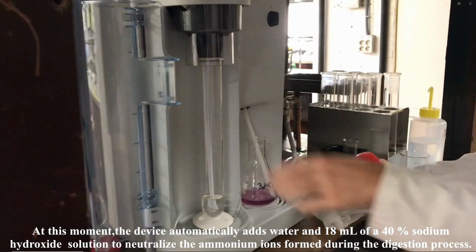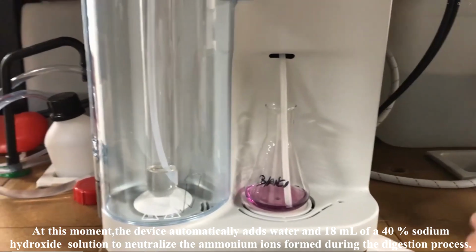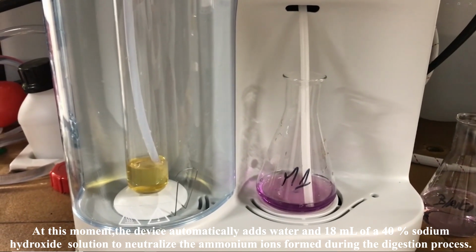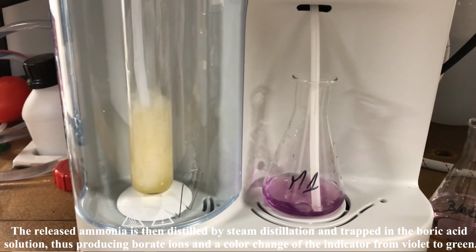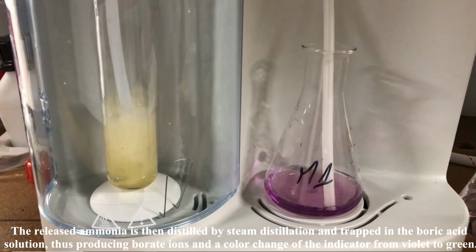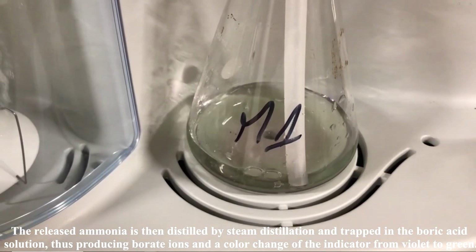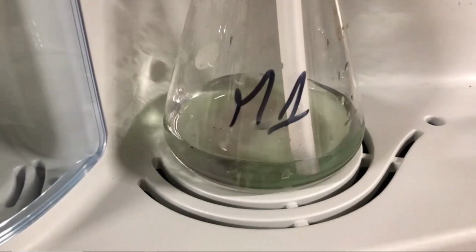At this moment, the device automatically adds water and 18 milliliters of a 40% sodium hydroxide solution to neutralize the ammonium ions formed during the digestion process. The released ammonia is then distilled by steam distillation and trapped in the boric acid solution, thus producing borate ions and a color change of the indicator from violet to green.